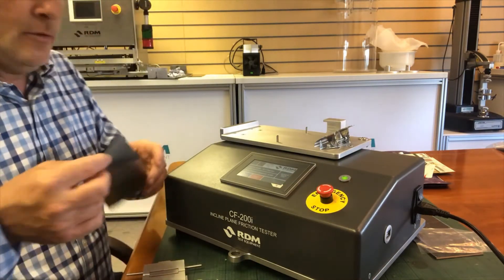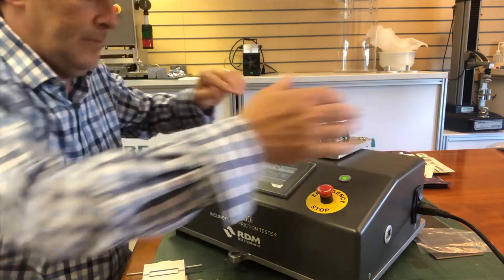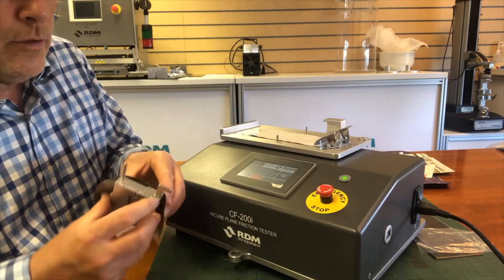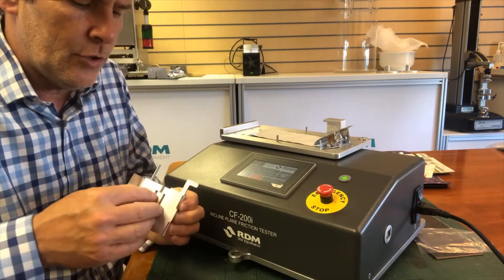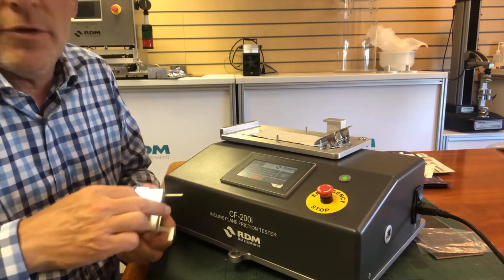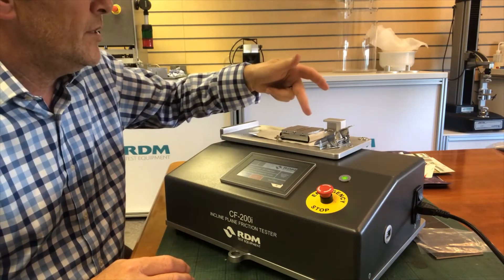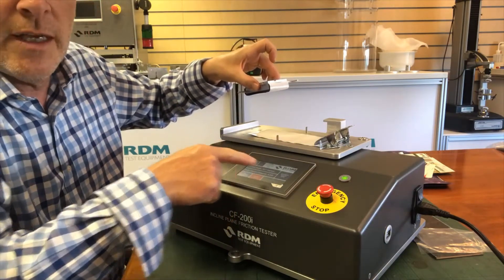Let's load up our first sample. That's our base material, and on the sled — which comes with the machine — this is a standard 200 gram ASTM standard sled, but you can choose an alternative sled or have your own special size made up if you like. We just load that in there. As I load the sled onto the machine, the start button on the touch screen here becomes active.